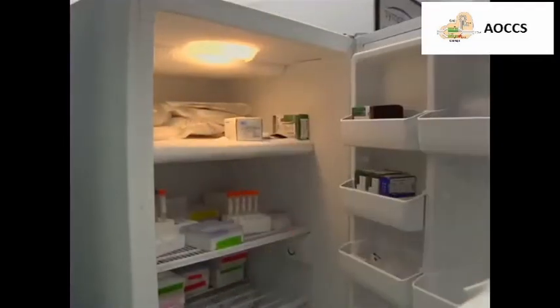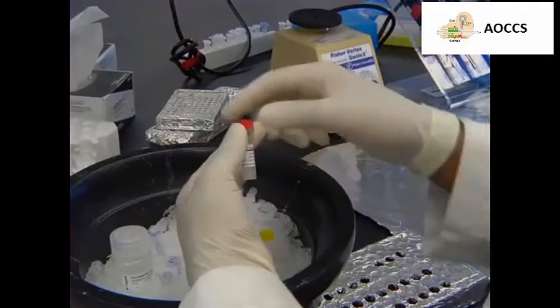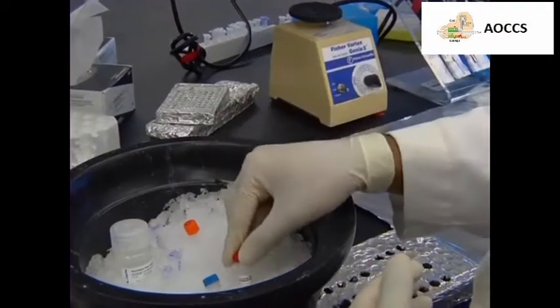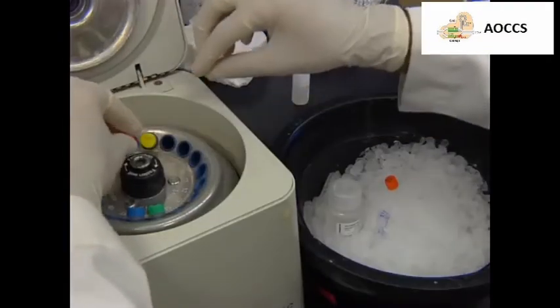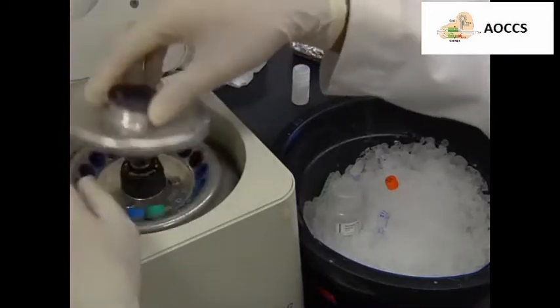Next, remove the enzymes from the freezer, flick the tubes, and place them on ice also. Once all the reagents have thawed, quickly spin them down.